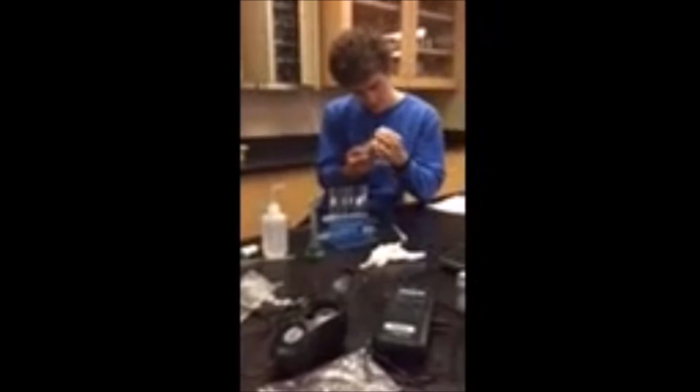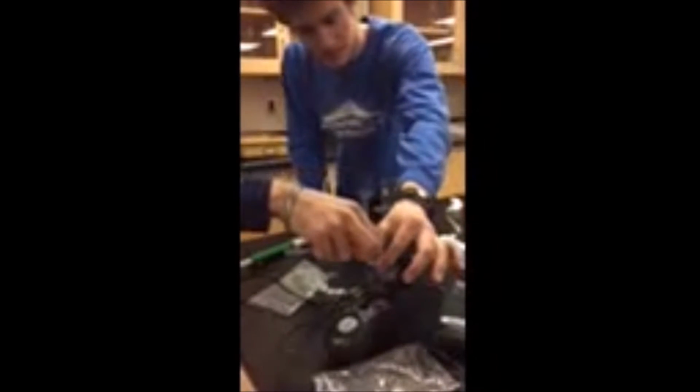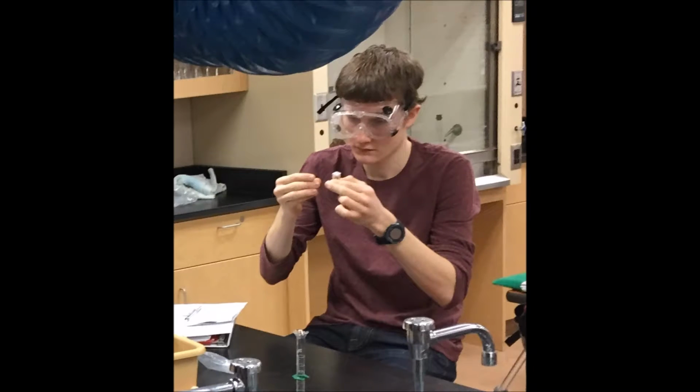It is important that sodium hydroxide is in excess, so all the crystal violet will eventually get used up. Using the calibration curve, we could then use absorbance data to analyze concentration over time. The concentration over time graphs could then be analyzed to find the reaction order of crystal violet.